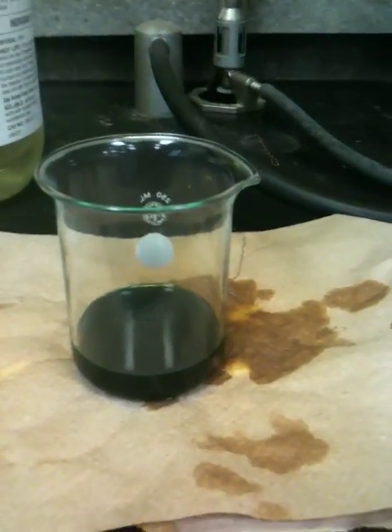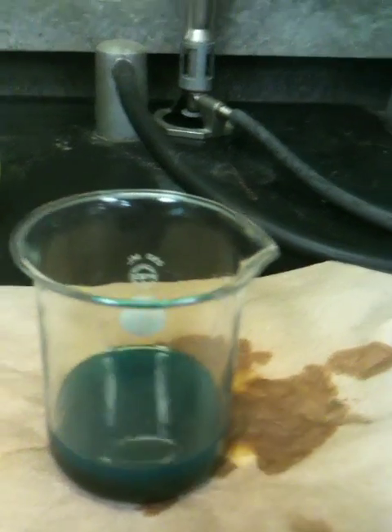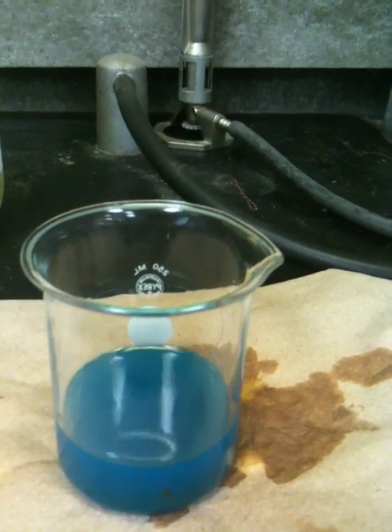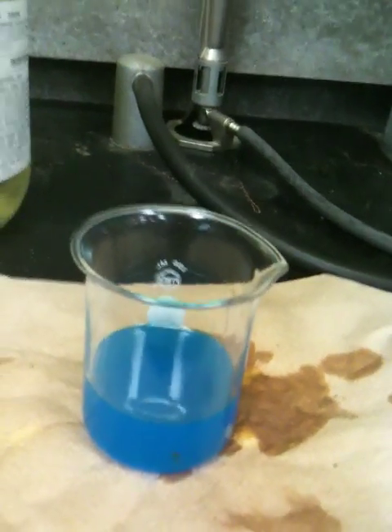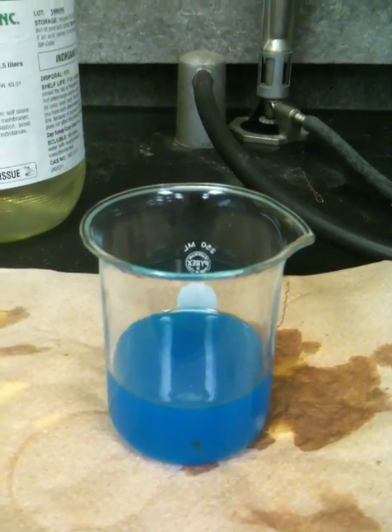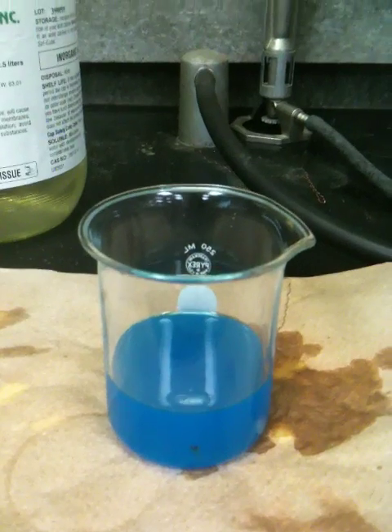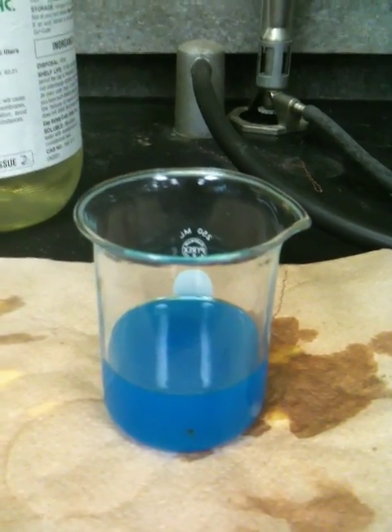What we do next is pour a little water in here to clarify the solution so we can see what's going on. And you can see we're getting some color now — look at that! Copper as an ion is turning blue in the water, giving that beautiful copper nitrate look. It's taking electrons from the copper to make it into an ion, and the ion in water shows the typical blue color. Copper has two different states, and in this particular state it will be blue.